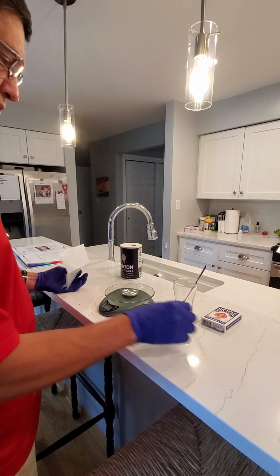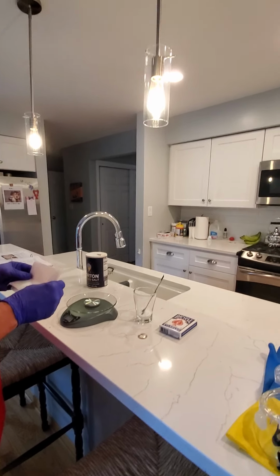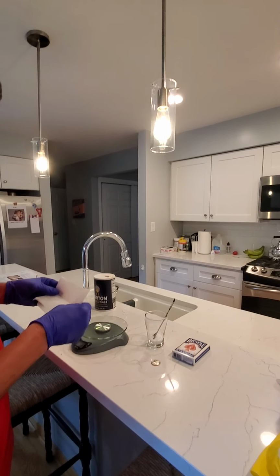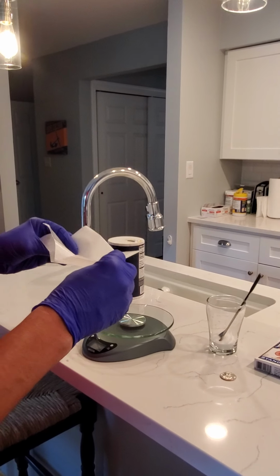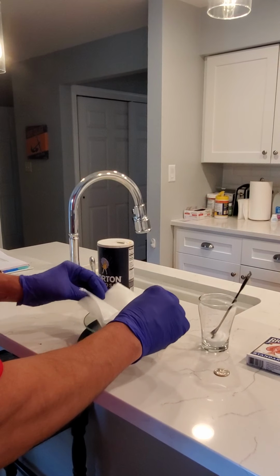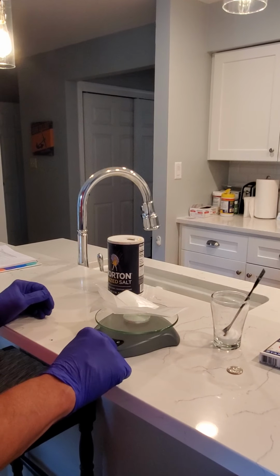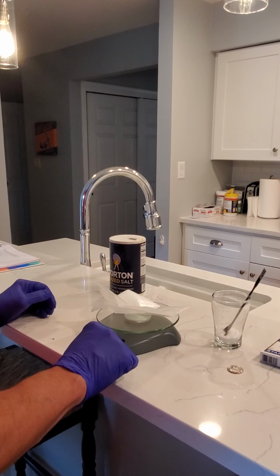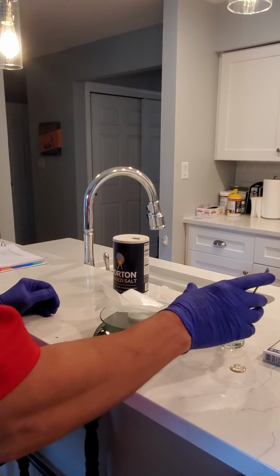You can also measure indirectly, and you'll be using the balance to measure solids. And we recommend making yourself a weighing dish or a weighing boat out of wax paper. You simply fold it in four. You can place it on the scale, and then the scale also has the feature of a tare where you can zero it, so you can measure your amount of solid directly.